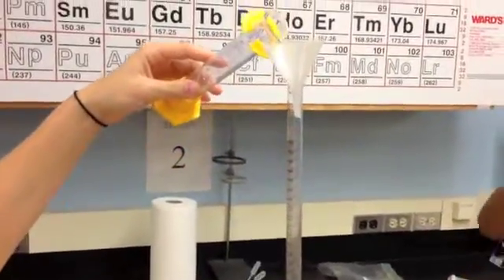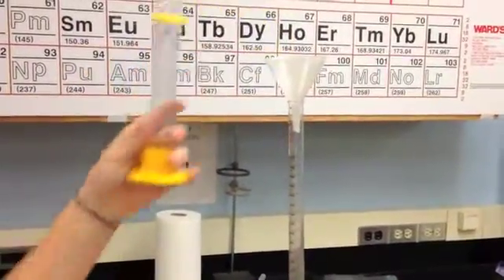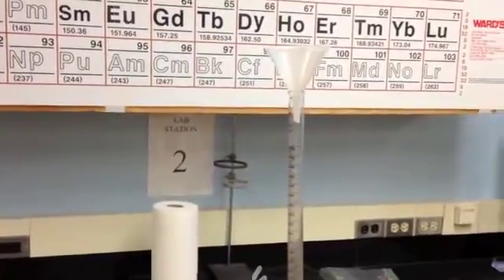Okay, I'm pouring in hydrochloric acid. How much? Wait, should we get that off of... Cool, 13?